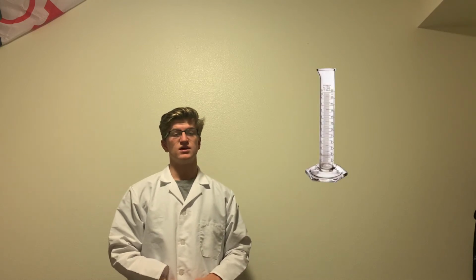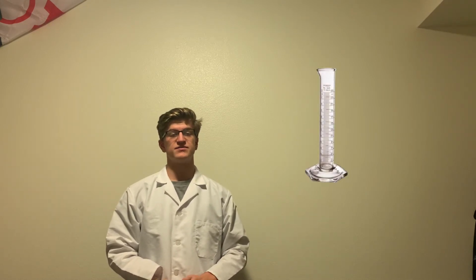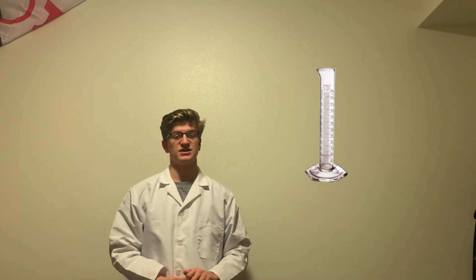Some of the most important of this equipment includes a Buchner funnel, a flask, paper filters, a hot plate, an ice bath, 2 graduated cylinders, 2 beakers, a specific amount of potassium oxalate hydrate, and some iron(III) chloride. These are not all the pieces of equipment we need, but these are some of the most important. For the rest of the equipment list, you can look in your lab notebook.